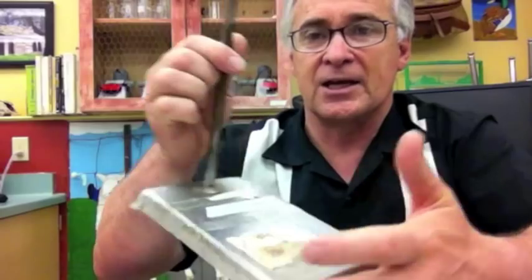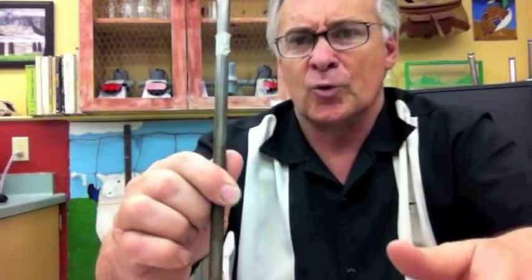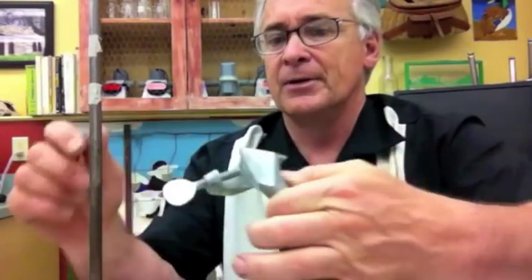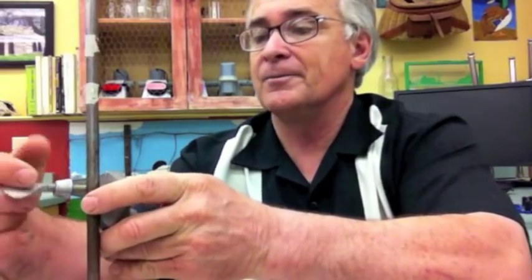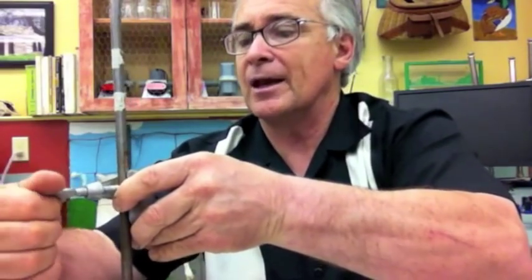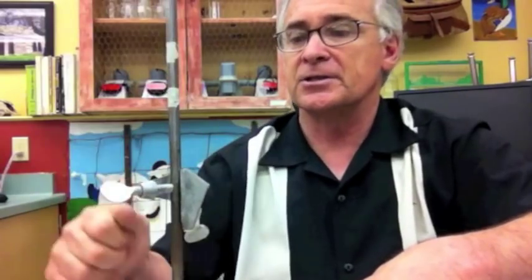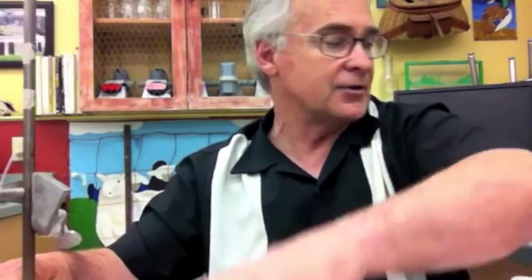First thing I would look for is a ring stand. This ring stand has a wide base and you've used them before in other labs, so you should know what a ring stand is. The thing that goes on the ring stand is a right angle clamp. The right angle clamp will allow you to put in the drop counter and adjust it relatively easily. The right angle clamp hooks to this upright or dowel and then has another clamp for the drop counter posts.